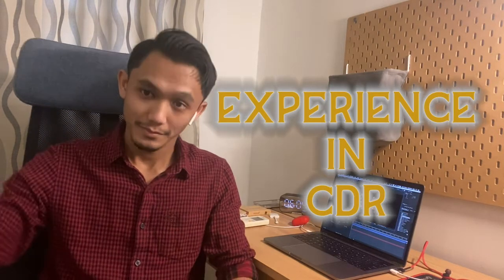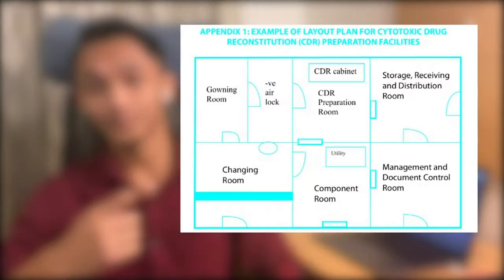Hi, I will be sharing my experience in CDR. Okay, let's get started. For your information, due to some issues at HSA, Hospital Sultanah Aminah, we need to go to the HSI, Hospital Sultan Ismail, in order to work on our CDR medications. So here's the layout of the CDR clean room.